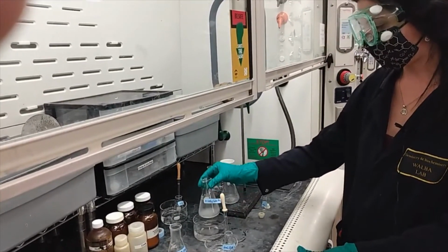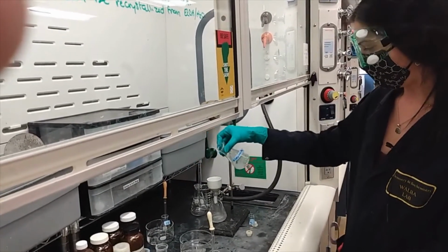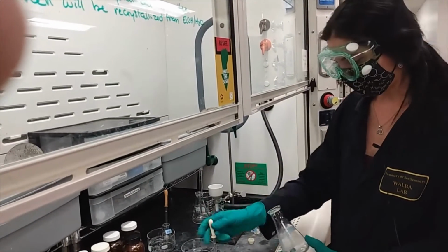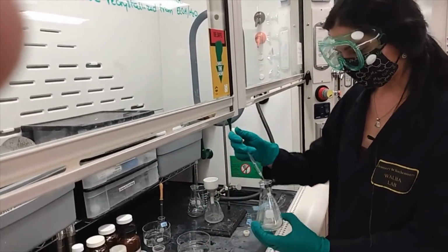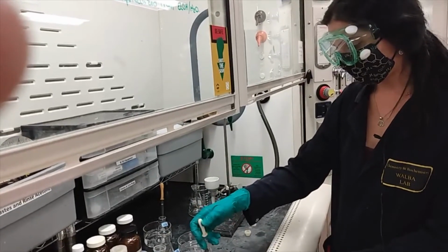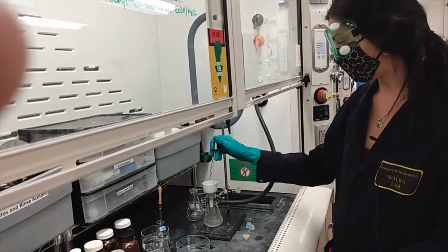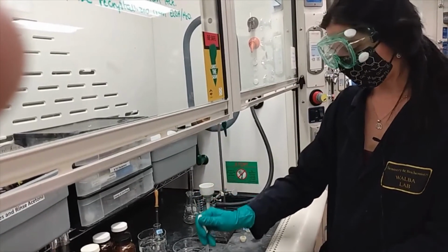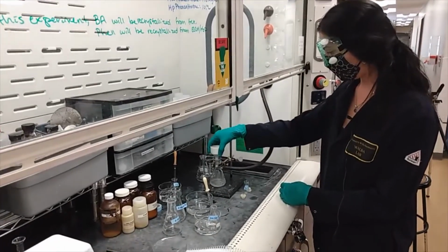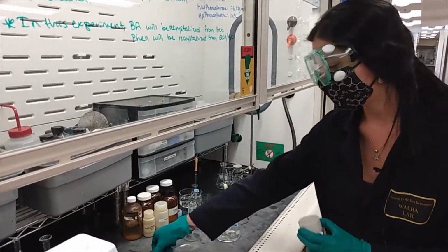So now we can pour our recrystallized phenanthrene crystals and solution through the filter paper. And just to make sure that we get as much of those impurities off the sample as possible, we're just going to rinse it with some of our chilled ethanol and water solvent mixture. Make sure you turn off the vacuum before trying to lift the Buchner funnel out of your filtration setup.